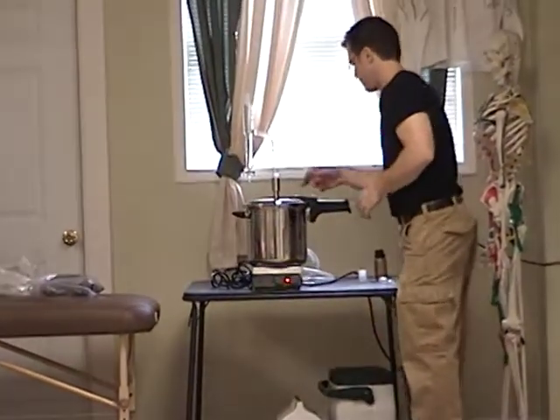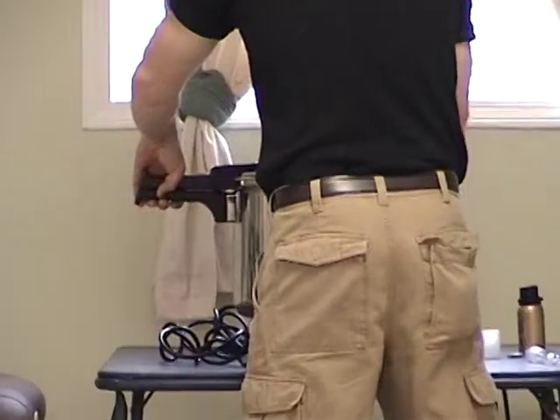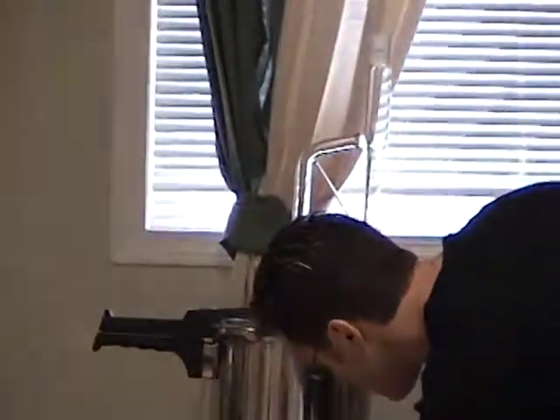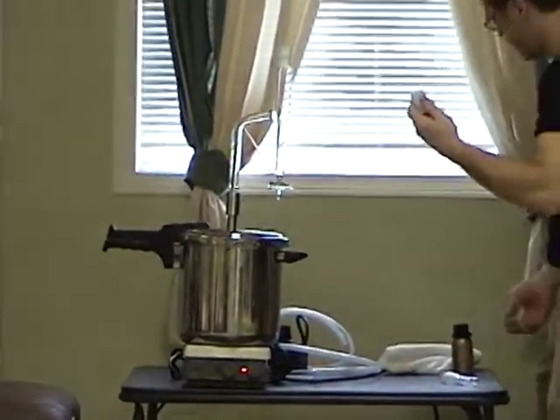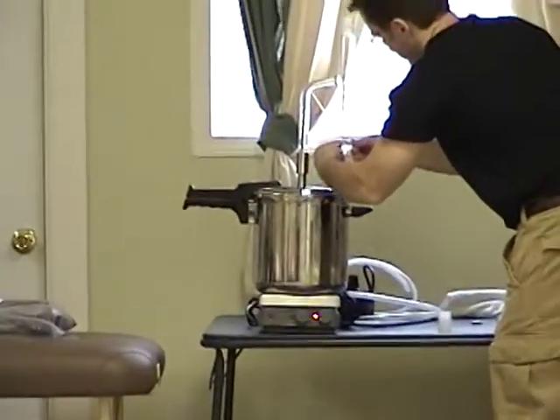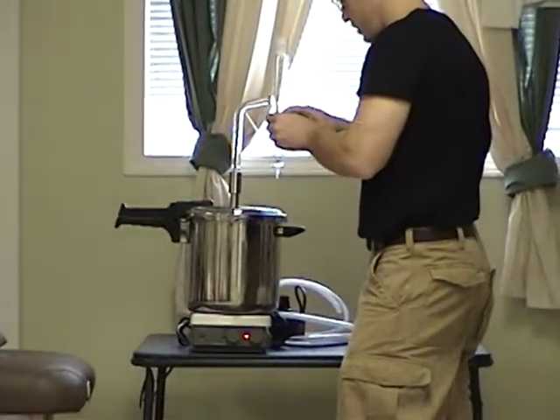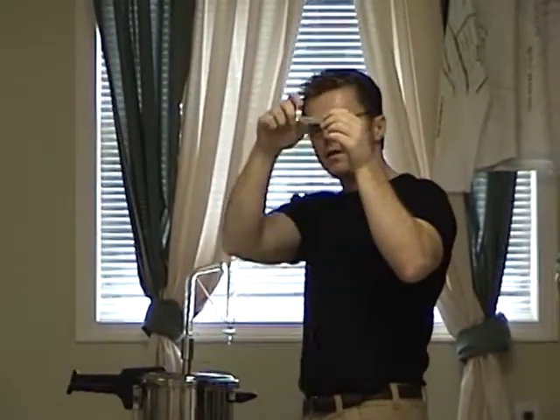All I did here was grease that joint and put it into this. We're going to prepare it — it's heating right now. It's going to take a little while for that much water to boil. This is just some non-reactive silicone grease. The stopcock — the part that allows you to drain the oil out — should also be greased lightly, because there's a small hole in the center that you do not want to clog up by putting too much grease on.